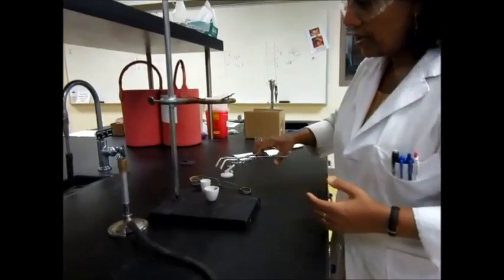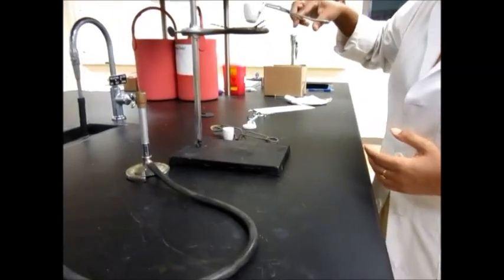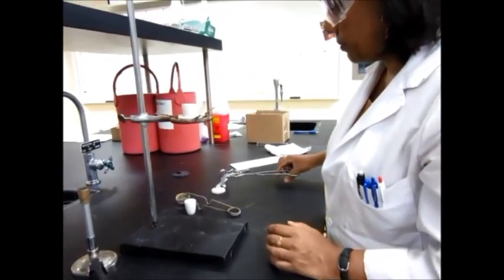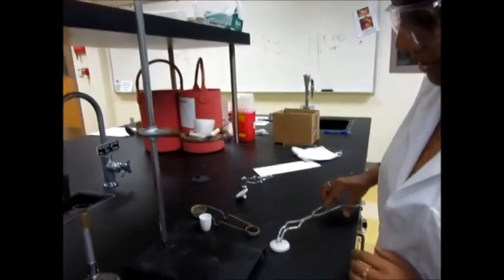Now if you wanted to heat a crucible, you're doing a reaction, you're done firing and you wanted to do a reaction, now you may also need to cover the crucible. So again you have to use a lid for this.